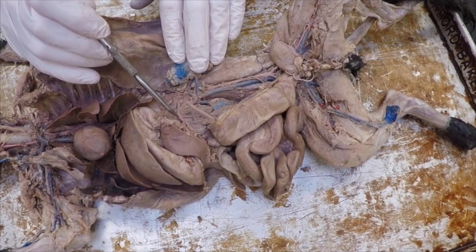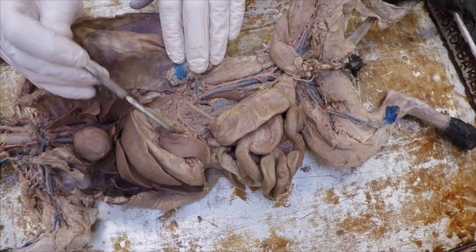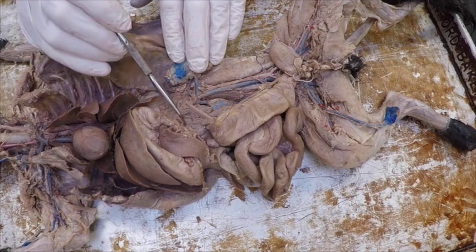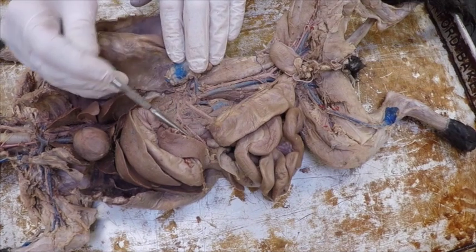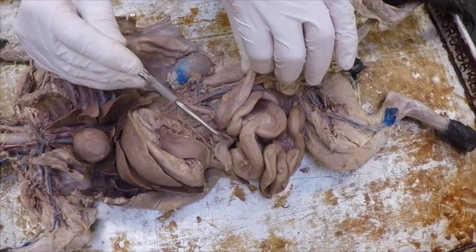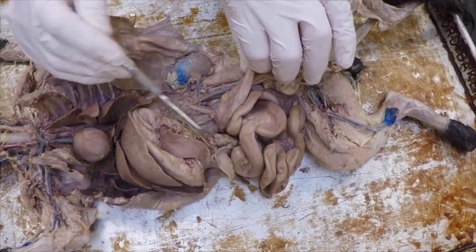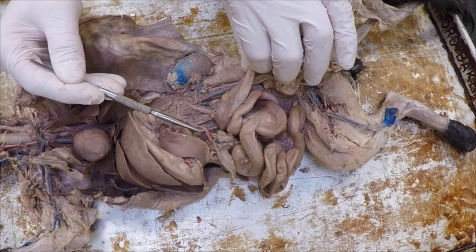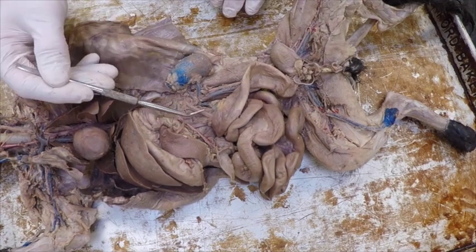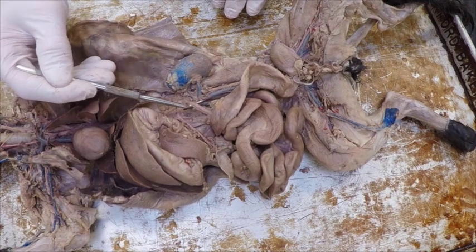If I follow out a little bit more, we get another artery that comes off right here, and it goes right into the spleen. It's called the splenic. If I follow this last branch out, and it's not easy to see, I can kind of hold it up, but eventually it goes into this pancreas here, this cottage cheese looking part, and then that is called my pancreatic, not too hard. This other one right over here is an artery right next to it. Again, they don't look super pink sometimes.